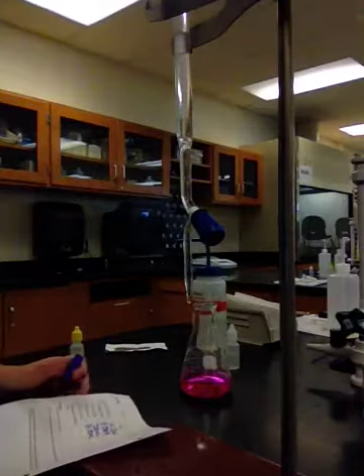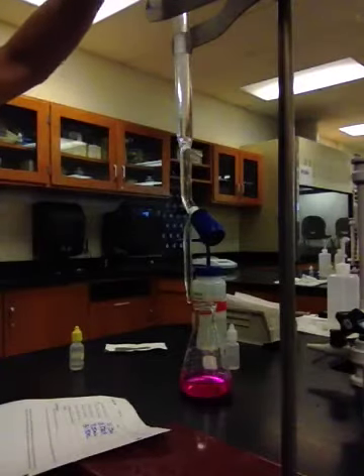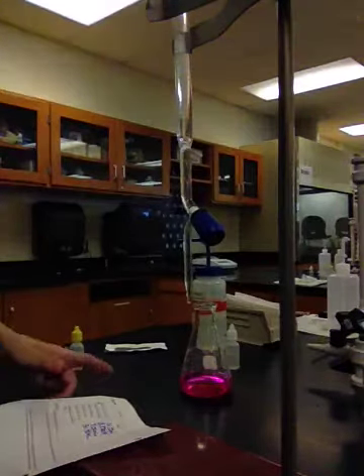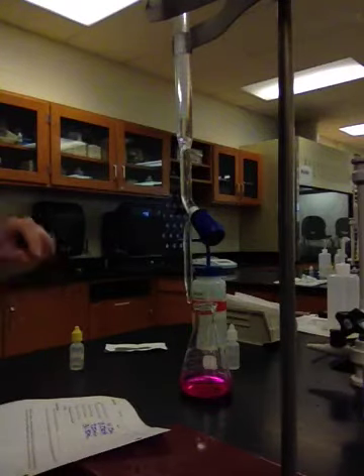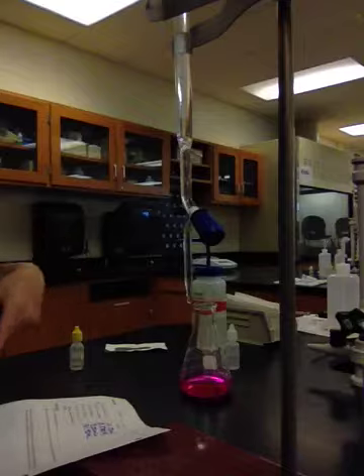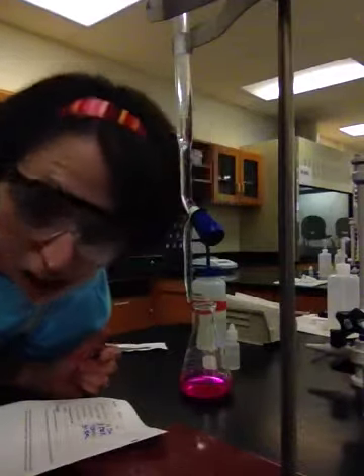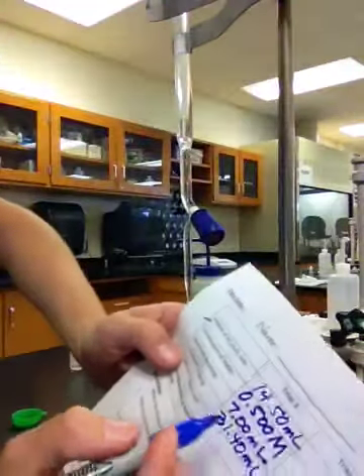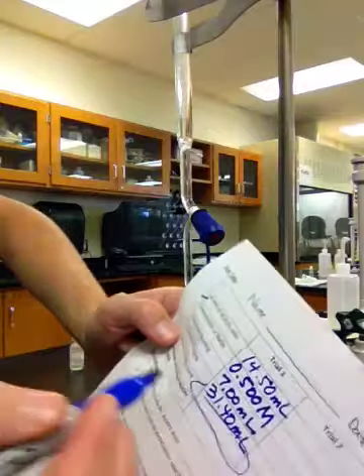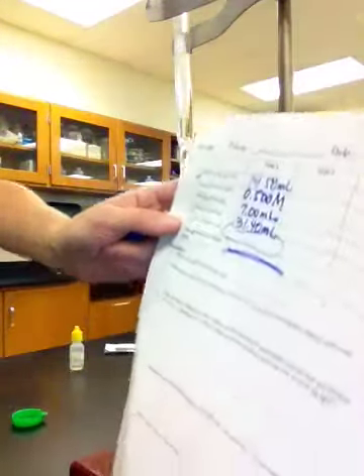Okay, now, that's what I was saying about the NaOH. Doesn't really matter where you start or where you end. What you're concerned about is the difference. So the initial burette reading was 7 milliliters. The final burette reading was 31.40 milliliters. Do you guys suppose you could calculate the amount of NaOH you used? So you guys using your savvy math skills, you should be able to figure out the amount of NaOH used. Okay? We do not have to worry about the average, so you don't have to do that part.